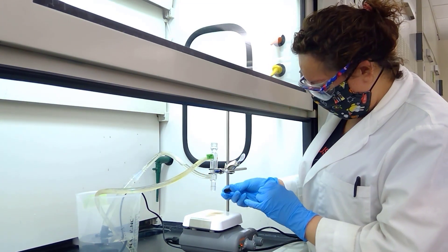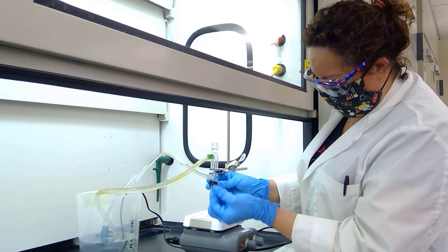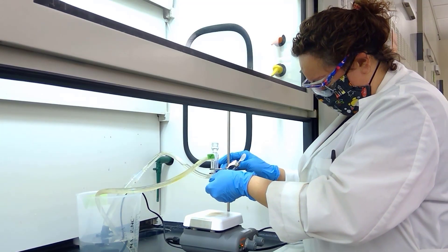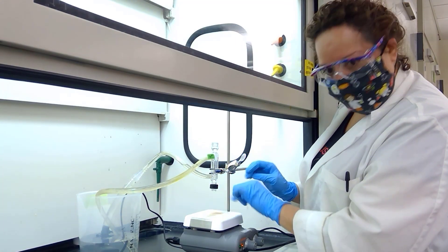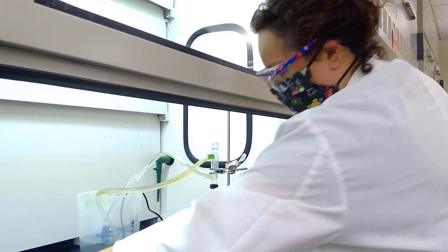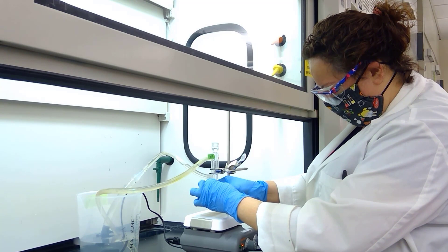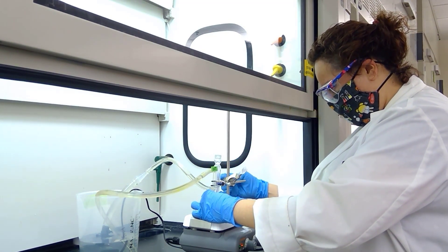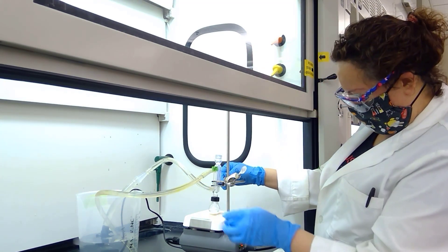I am adding a cap. My cap has a hole so that it will be able to fit on the water jacket, and then I'm adding a rubber gasket or O-ring. That will prevent my cap from sliding forward. Now I'm ready to attach the round bottom flask. Now I have a nice secure apparatus that I can use for reflux.